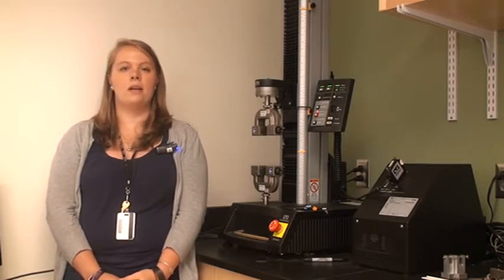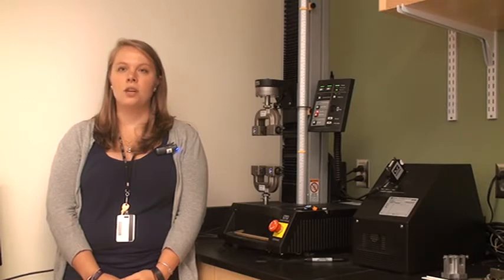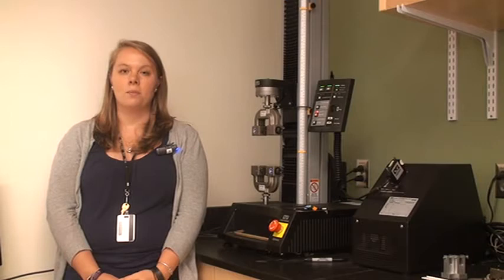Hi, my name is Jen and I'm from the biomedical engineering department at Worcester Polytechnic Institute. Today I'm going to show you a short video tutorial on how to load a sample for tensile testing using our Instron 5544 materials testing system and screw action grips.